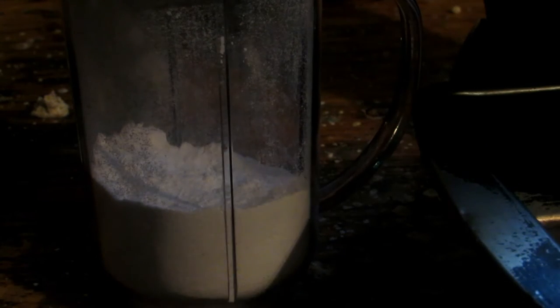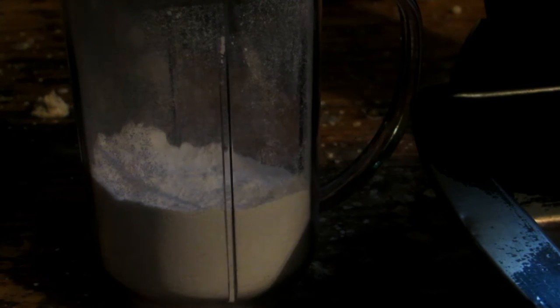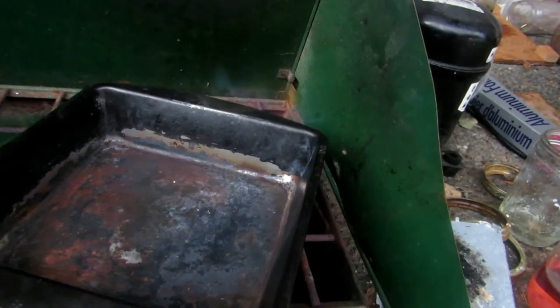You must now get something such as this old baking pan, and we can put all of our reactant inside outside and put it on a gas stove, or heat it up really hot with a blowtorch. Just make sure you don't care about the pan, because this will probably destroy your pan. Upon heating it, a reaction will occur, and I'll write up the chemical equation after we go outside.